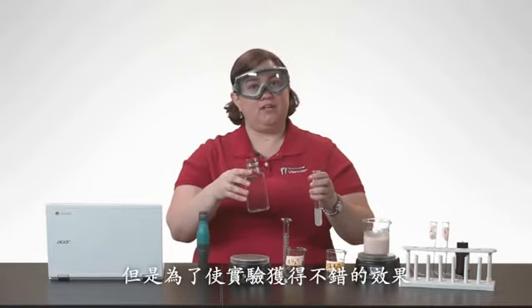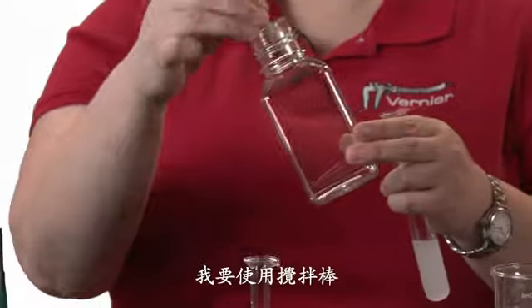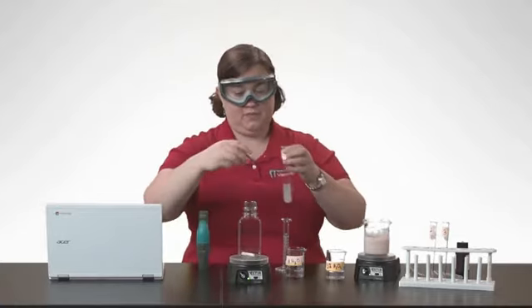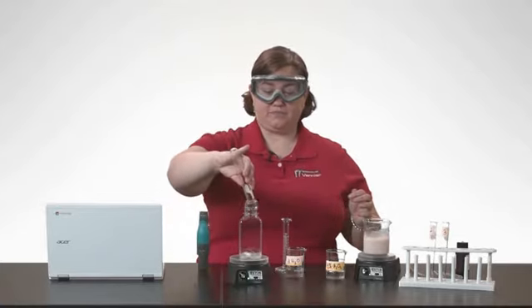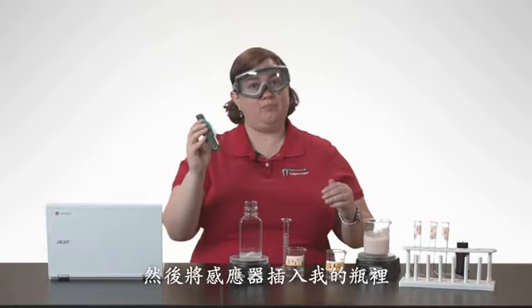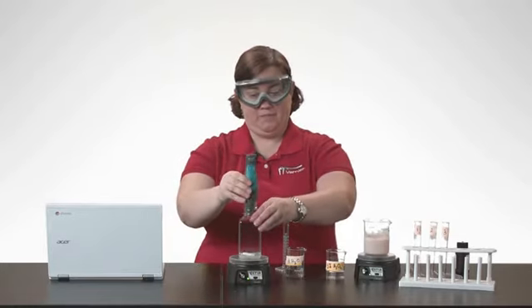But for this experiment, to help ensure I get great results, I'm going to add a stir bar, and I'm going to be using it on a stir station. So I add my solution, and then I'm going to go ahead and put my oxygen gas sensor into my bottle.